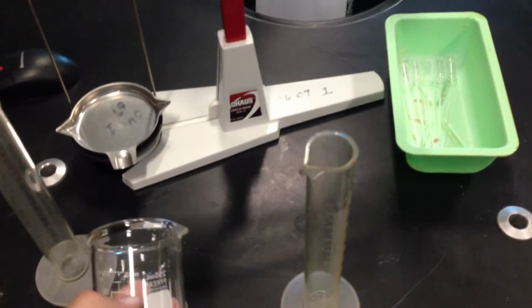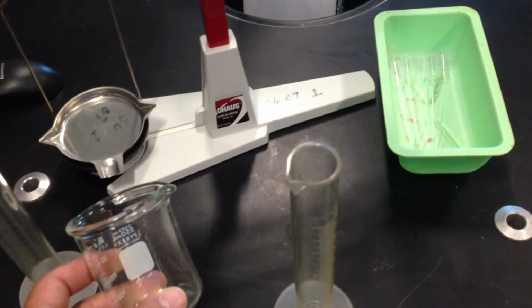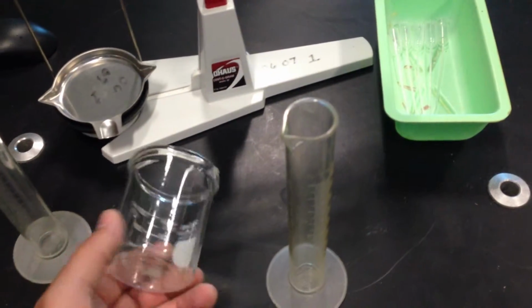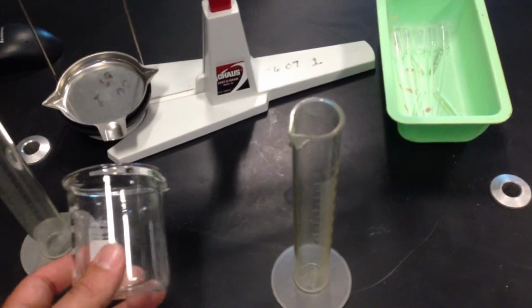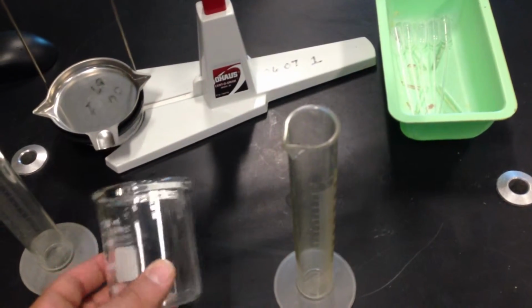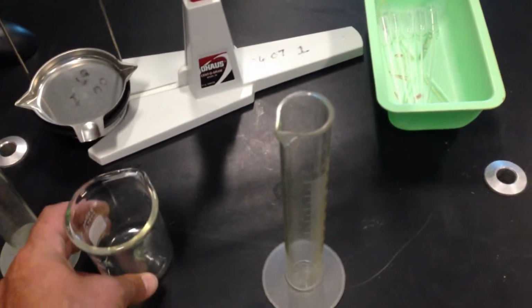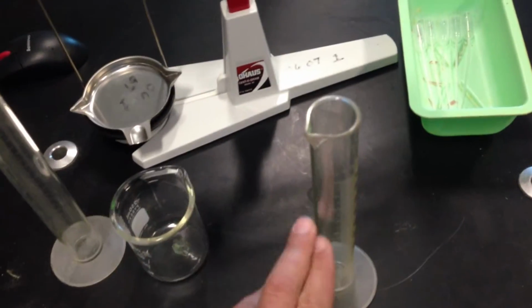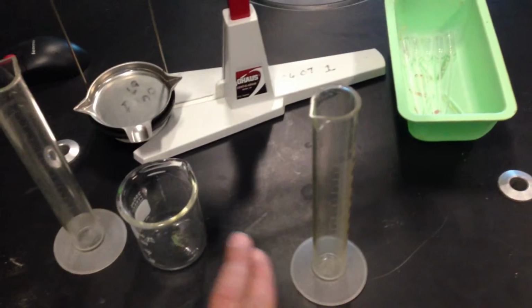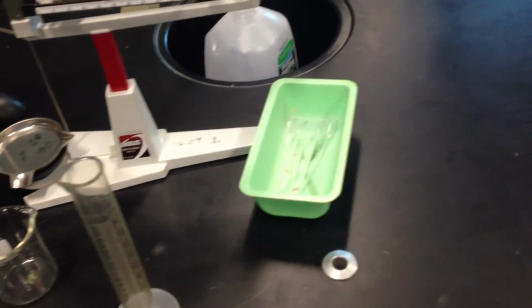If you're doing the density of Coke, okay, with a lot of sugar that it has, a lot of carbohydrates, and then you do water, but you don't clean this out, isn't the water going to be a little more dense than it should be? Yes, you have to be very, very careful to make sure you don't contaminate your results, making sure that when you do this test, wash out your graduated cylinder and your beaker. And that's all there is to it.